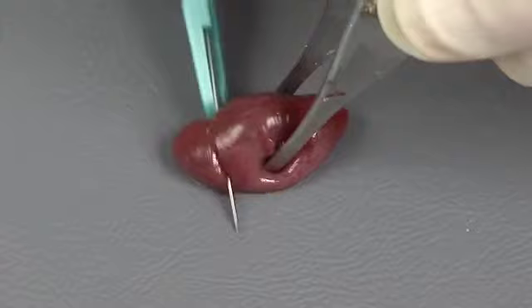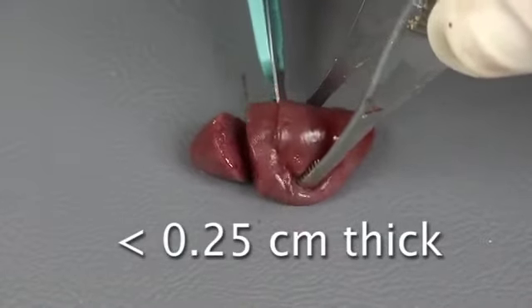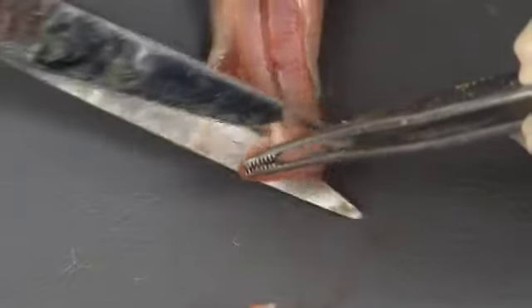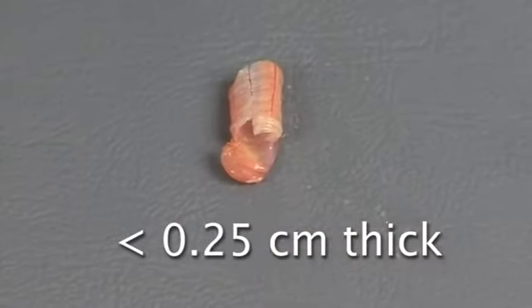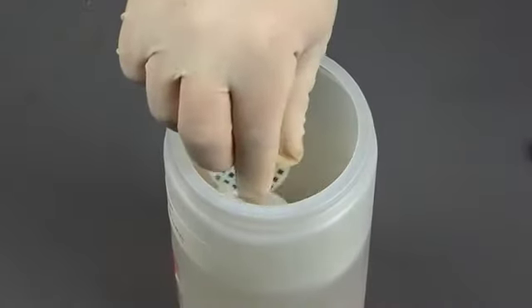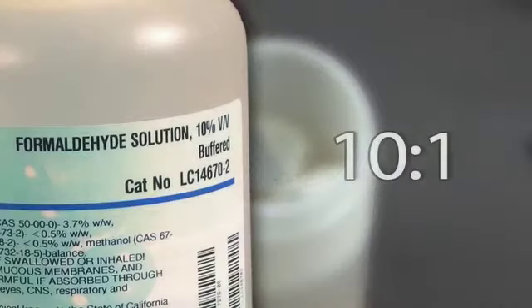Trim samples of parenchymal organs to no more than 0.25 centimeters thick in order to allow the formalin to penetrate the tissue. Samples of tubular organs can be any length as long as their walls are no more than 0.25 centimeters thick. Place the tissues in 10% neutral buffered formalin for fixation. The ratio of formalin to tissue volume in the container should be at least 10:1.